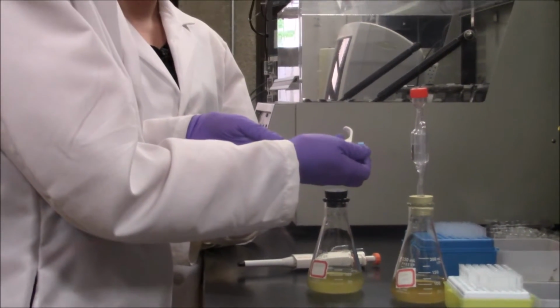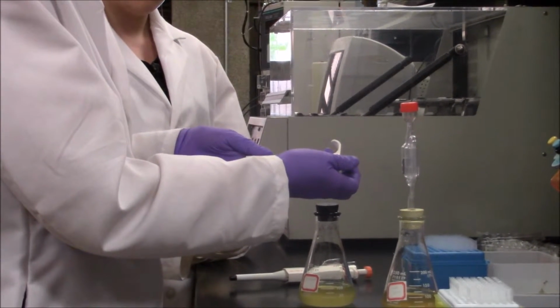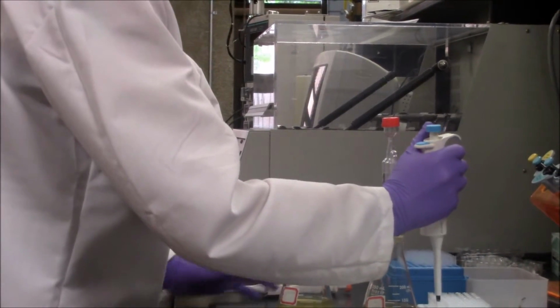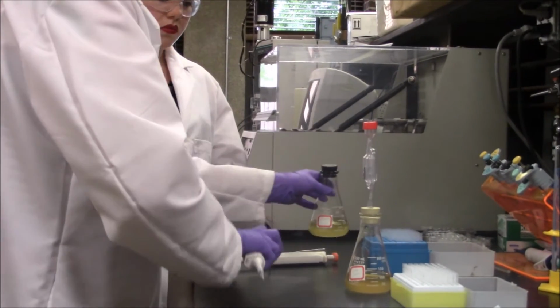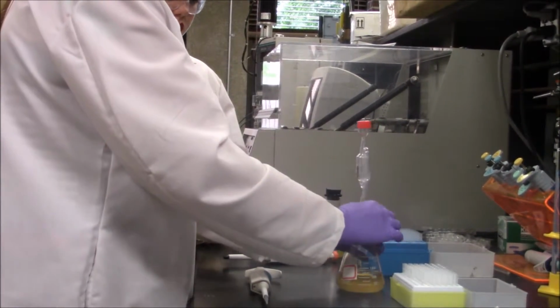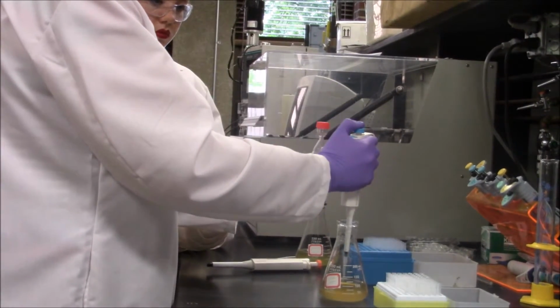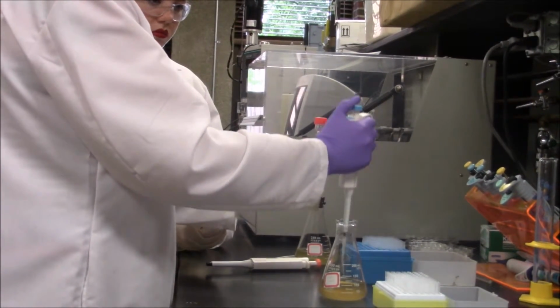Your results from the glucose meter will need to be converted to grams per liter using the calibration curve. If you are using a new batch of test strips, remember to make a new calibration curve. If your results fall out of the range of the calibration curve, your solution may need to be diluted further. Remember, after your meter readings are converted to grams per liter, they will need to be multiplied by the dilution factor.